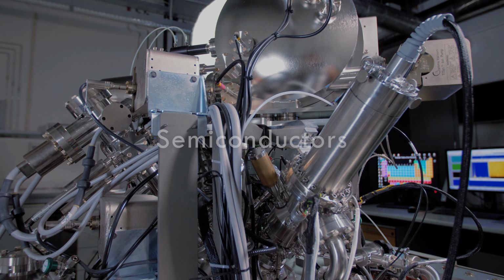One major advantage of ToF-SIMS is the opportunity to combine high lateral and high depth resolution. In the so-called dual beam depth profiling, it is possible to optimize the analysis beam and the sputter beam independently and measure 3D chemical profiles.